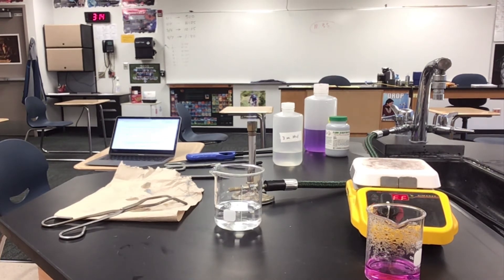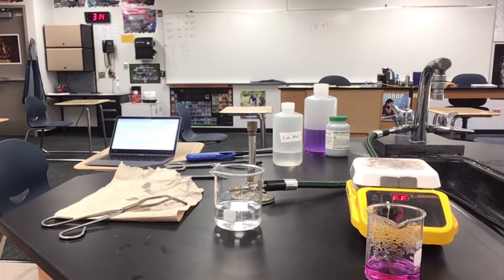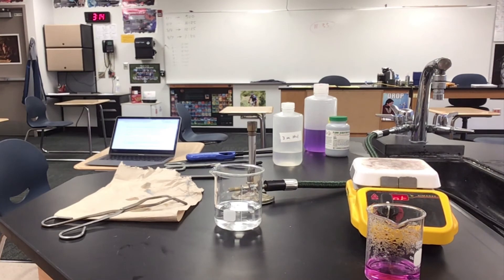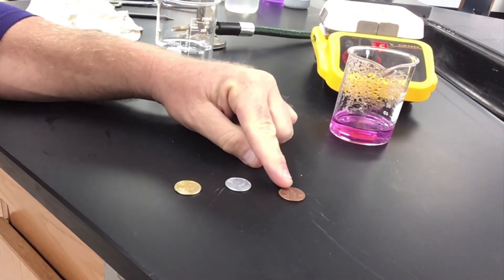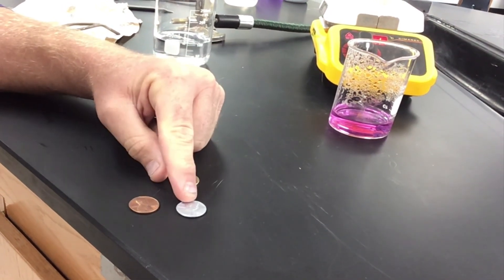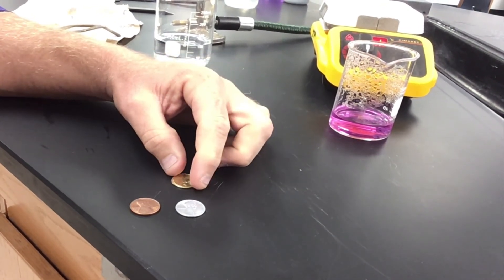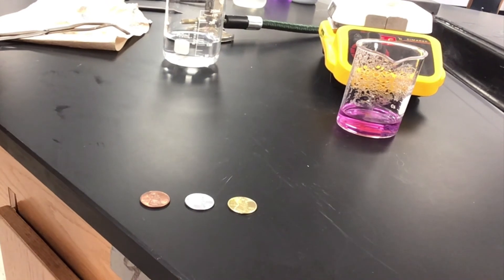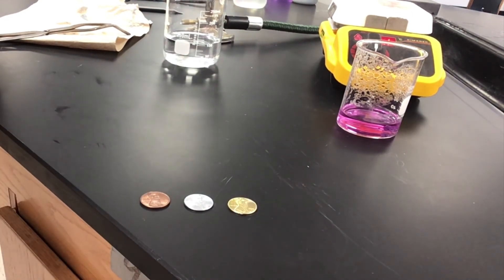Let's take a look at these. I'll bring over one of our original copper pennies. I'm going to turn my Bunsen burner off because we don't want an open flame when we don't need one. If we zoom in on our pennies, we have the original copper color, then we have the zinc plated penny that was created in the boiling base, and we have the brass one that we created. All three are still legal tender — we can actually spend them.